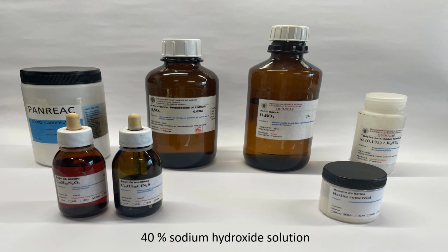Additionally, a 40% sodium hydroxide solution is required, as the boric acid solution is already prepared.